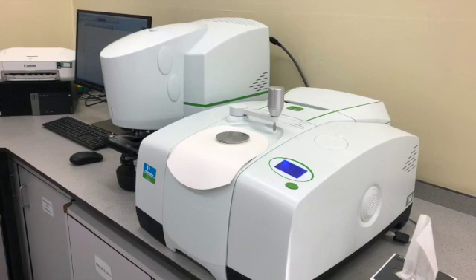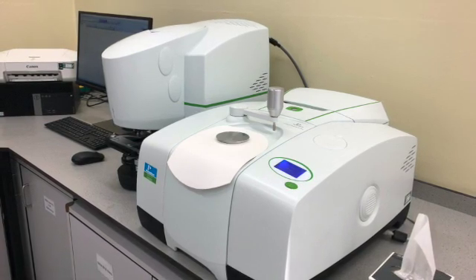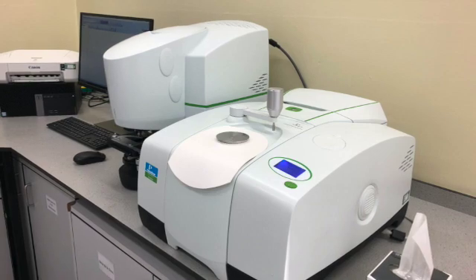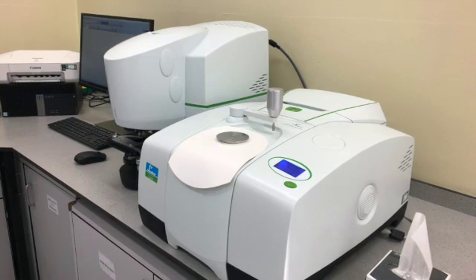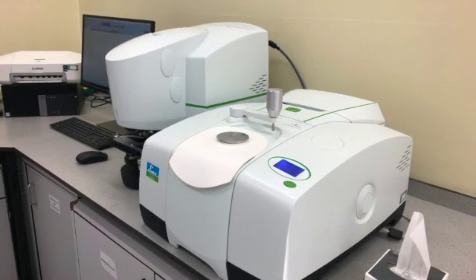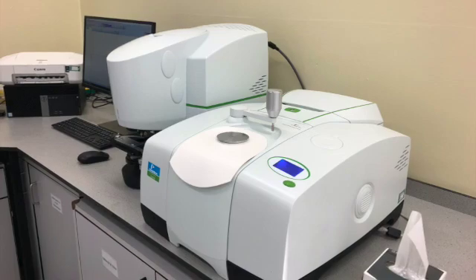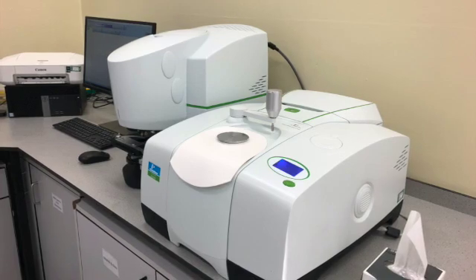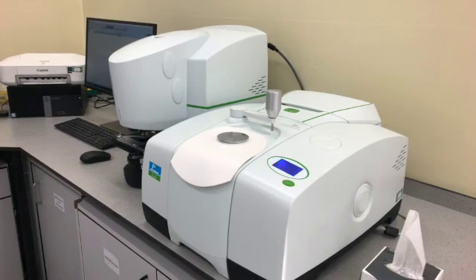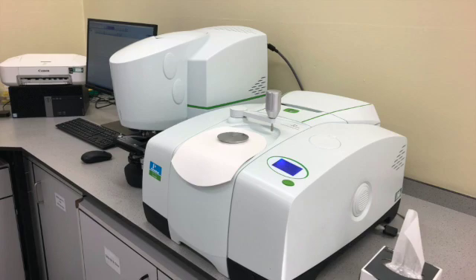What we're going to do is use this ATR to analyse a paint fragment. So instead of doing the preparation for cross-section, we're just going to use the paint sample as is, without any prior preparation.